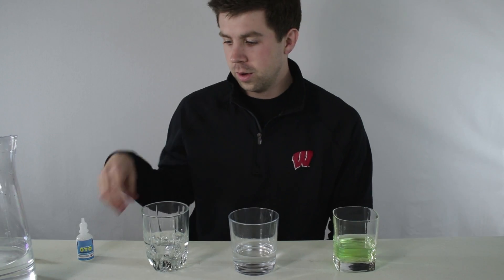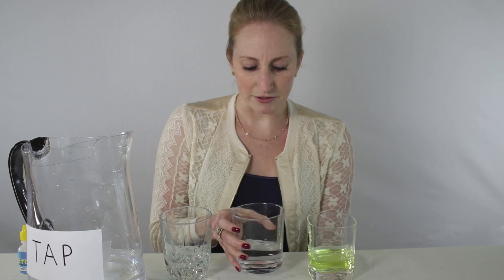Put 10 drops? Mhmm. It's not doing anything. Is that a good thing? Why isn't it yellow at all? You absorbed the chlorine. Your skin did.